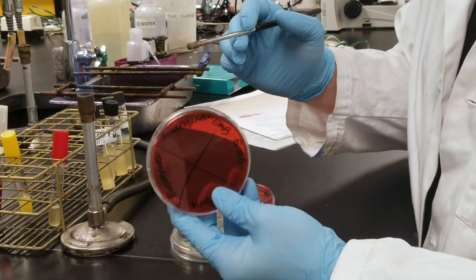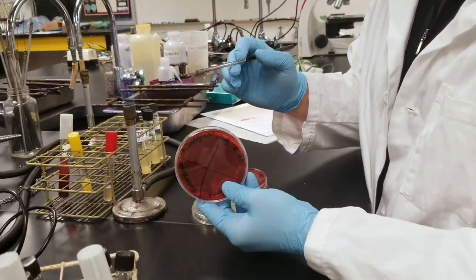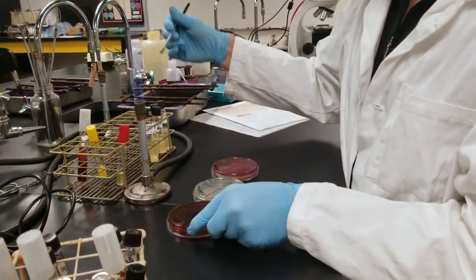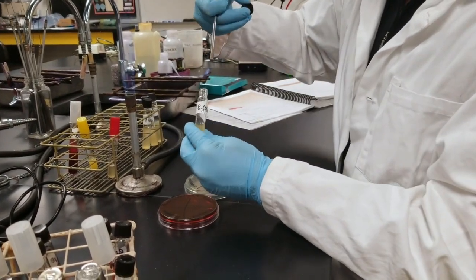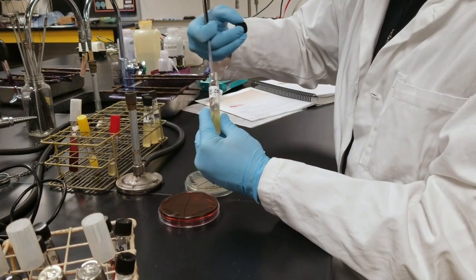This is going to be just like any other technique we've done. I'm going to take my E. coli for example. I'm going to dip my sterile loop into the E. coli.